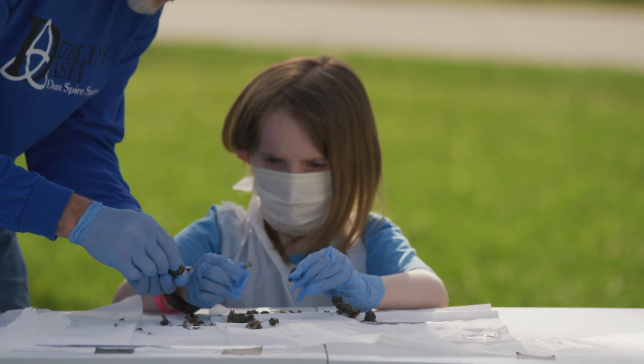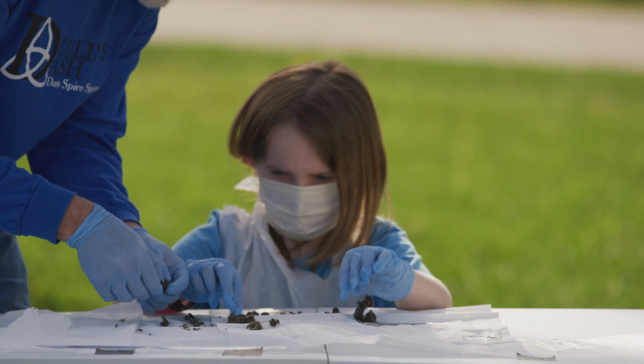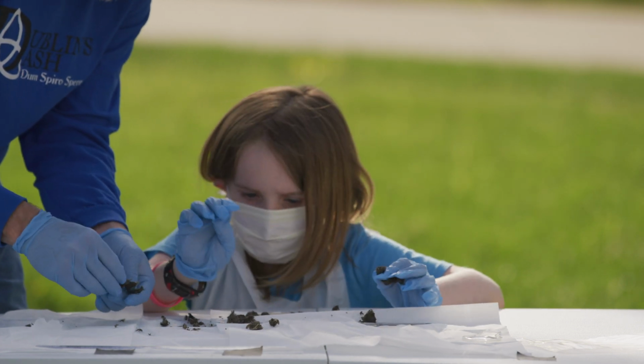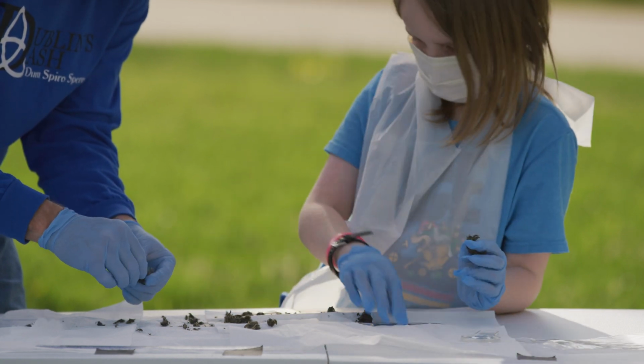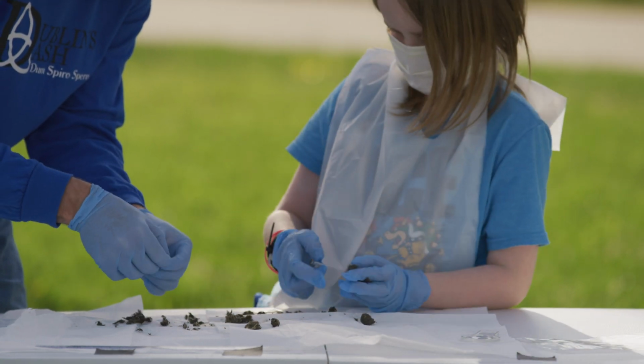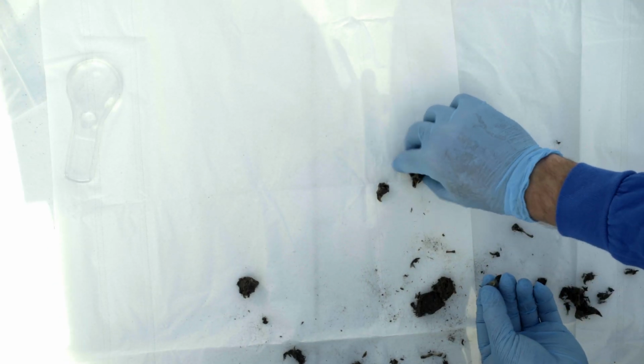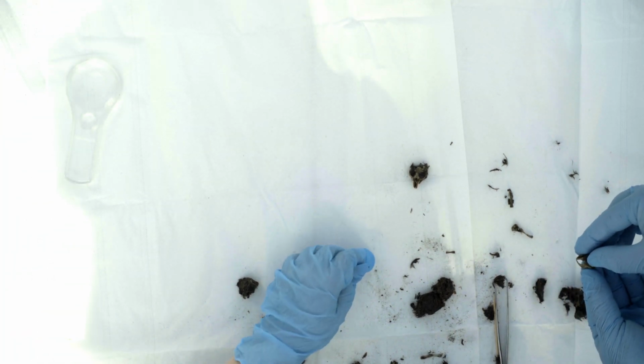I got a bone right here. There's a lower jaw. That seems like a leg bone. Look at this one. Looks like teeth. See, this is a lower jaw for something. You see the little teeth right there? Yeah. I bet he goes with this guy, because there's his upper teeth. Look at that. Chomp, chomp, chomp. I bet that was a little mole that used to run around underground.